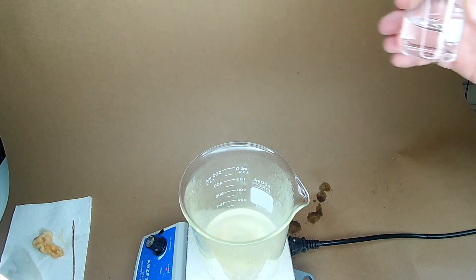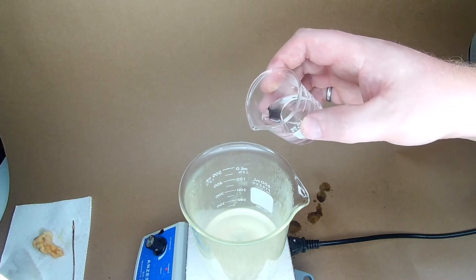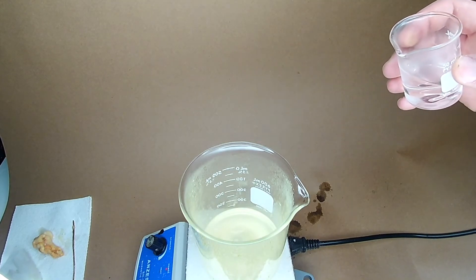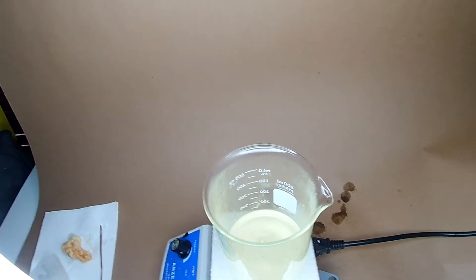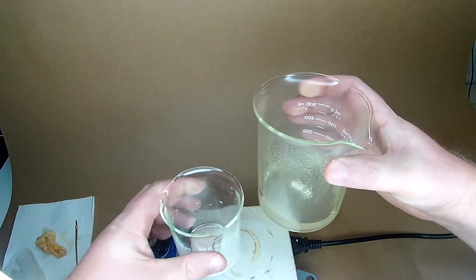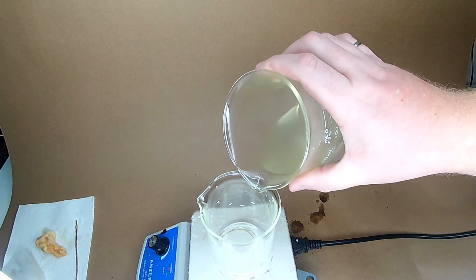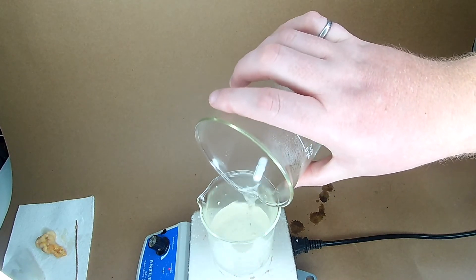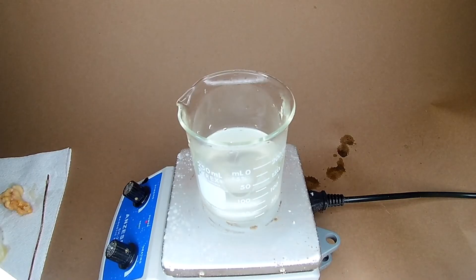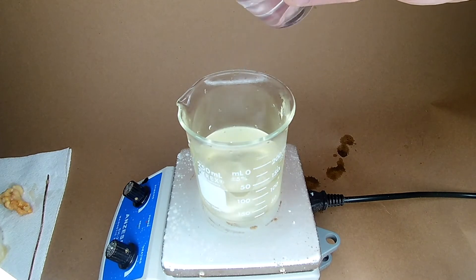Hydrochloric acid was added to the solution to create sodium chloride from the sodium hydroxide and sodium iodide. With each pour of hydrochloric acid you can see iodine forming and then dissolving.